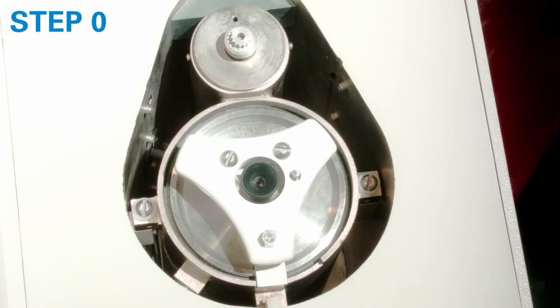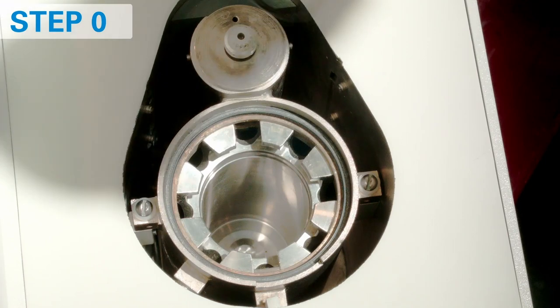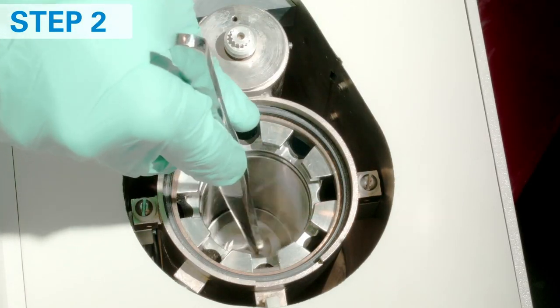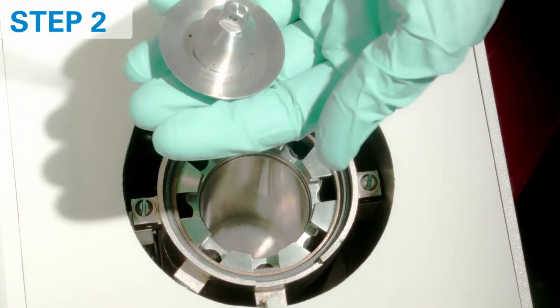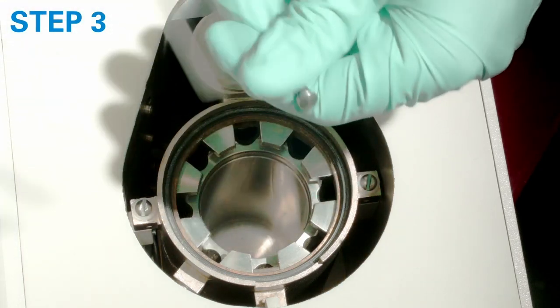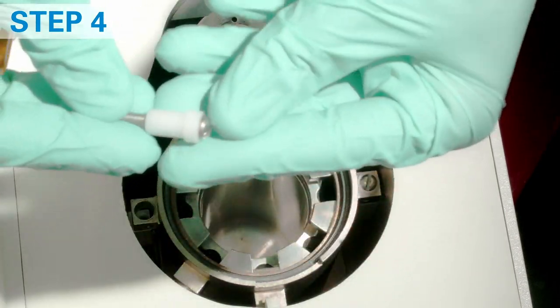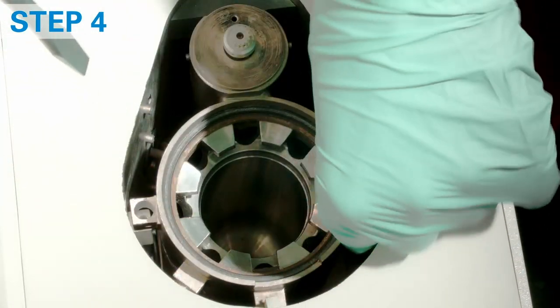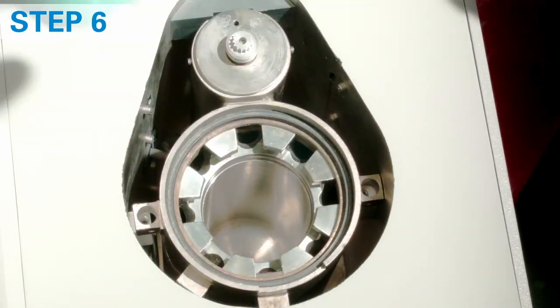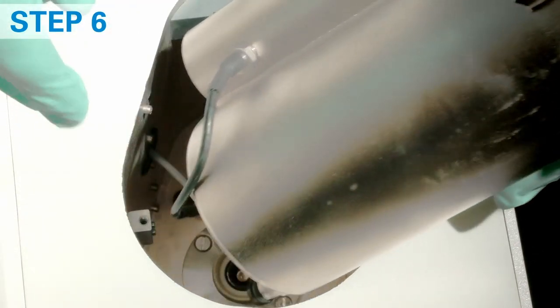Open the lid and remove the vessel's head. Take off the stirrer belt. Remove the ash filter if present. Also remove the bottom check valve. Remove two screws using the flat screwdriver. Using pliers, remove the plastic wedge. Now carefully pull the bucket assembly and disconnect the bucket thermistor.